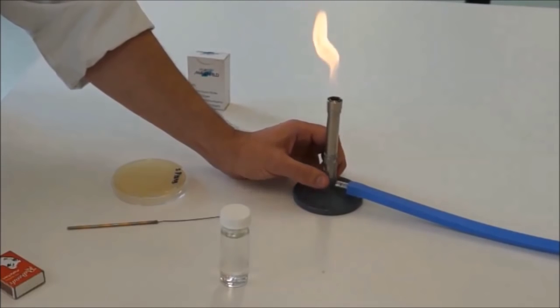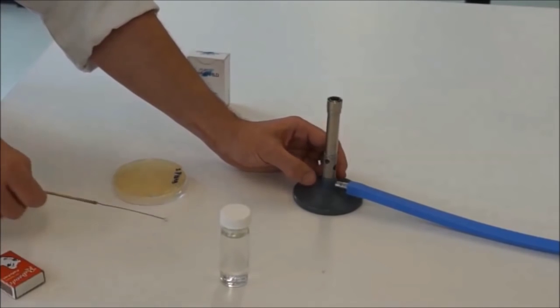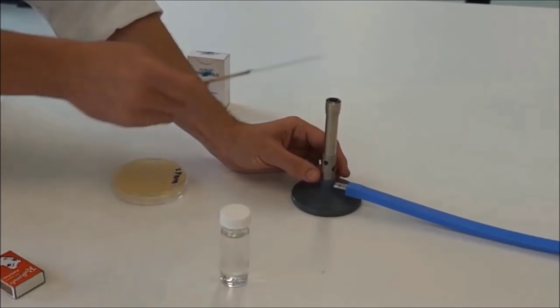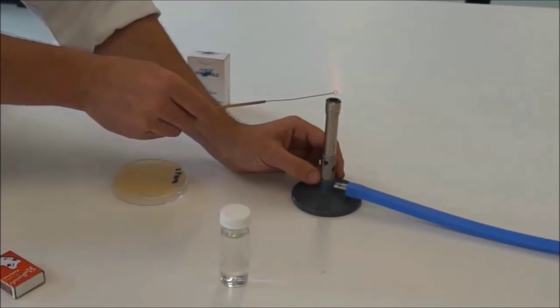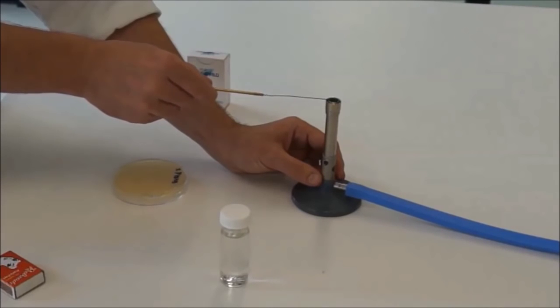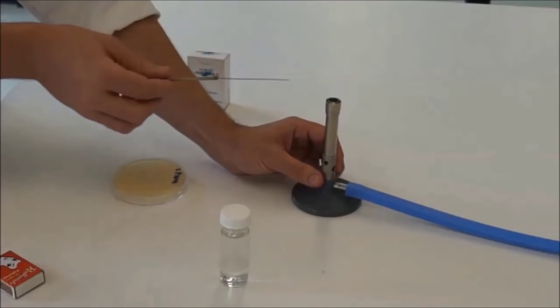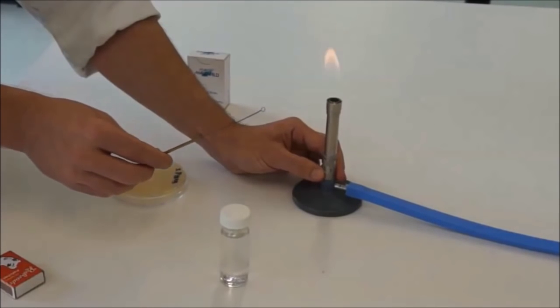When you're actually using this for its function, you're going to have to use the blue flame. And the hottest part of the flame, a lot of people try and heat up this loop right down here at the base, and what you've got down at the base is unburnt gas. You can see that the loop isn't going red hot. What you need to do is lift the loop up into the hot part of the flame where the gas is actually burning. So that's nice and hot there. It's about 1500 degrees, so be very wary of this. Back to yellow flame.